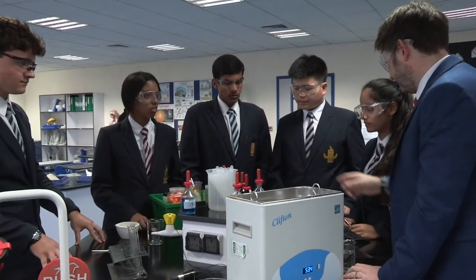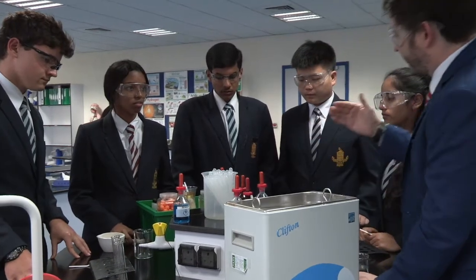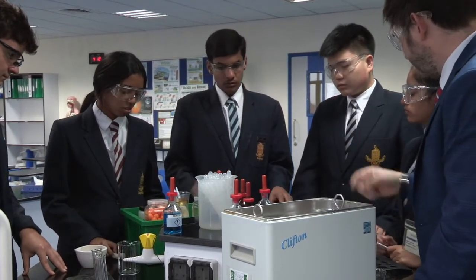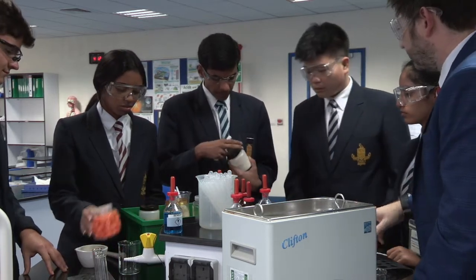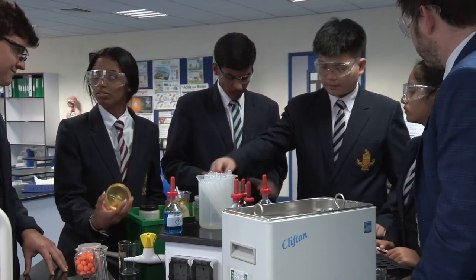So here's my challenge to you: I want you to use your pestle and mortar, select a food that you think is going to have a really high glucose content, and select one that you think will have a slightly lower glucose content. Carry out the test and prove to me that you're right by showing me something that looks red and something that looks orange or yellow. You've got all these things to choose from — completely up to you, you go for it.